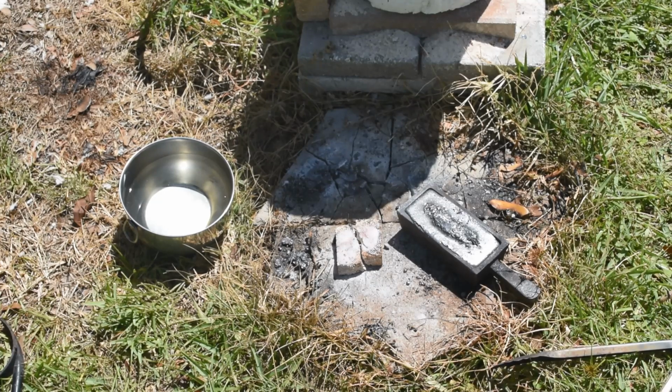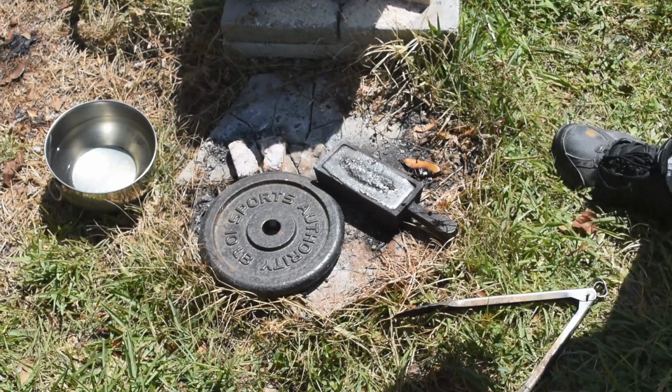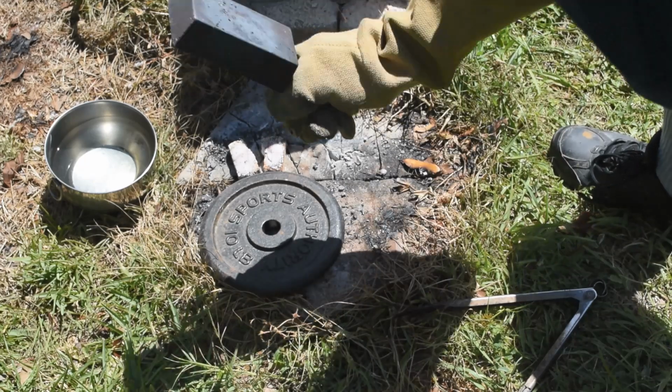I mean, the cast iron mold has a good relief angle on the inside of it, so hopefully it will break free. It's also really too hard to grab, even through my welding gloves, so let it cool down a little bit, and I'll get something harder to hammer on over here, and we'll see if we can bust it loose, because all I'm doing is destroying the concrete. Okay, I got a steel barbell weight here to use as an anvil. I got my Kevlar kiln gloves on.